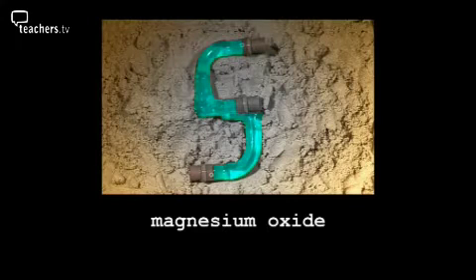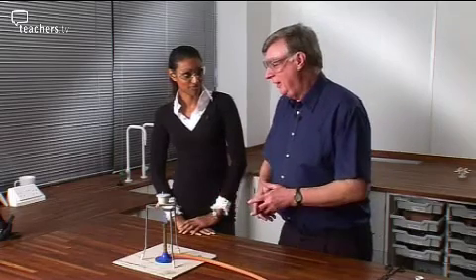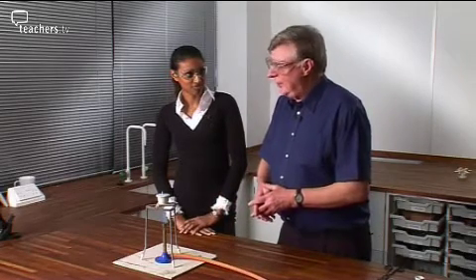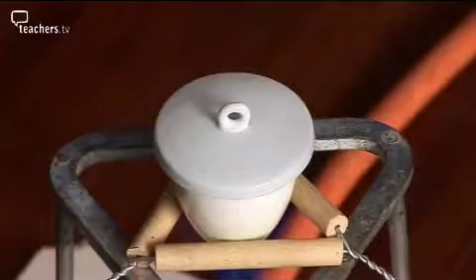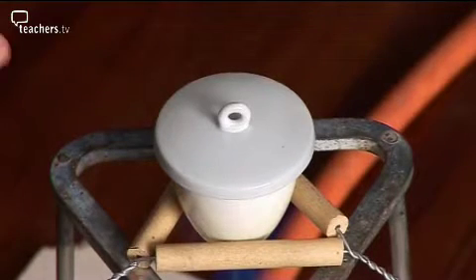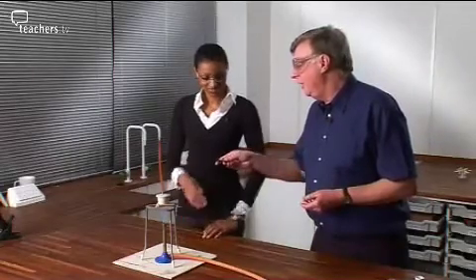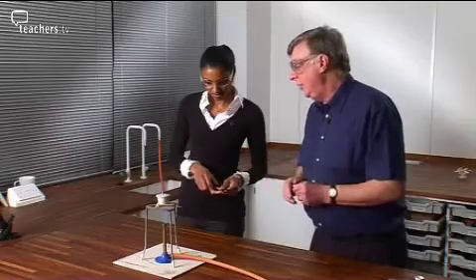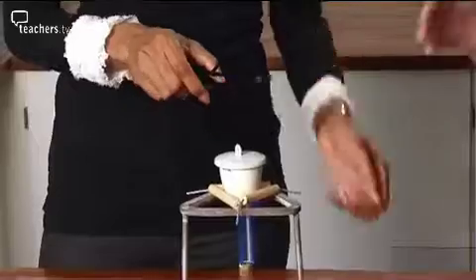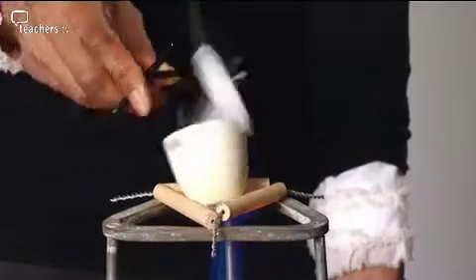Into the top 5, and it's the old classic, making magnesium oxide. This is a popular experiment carried out for GCSE, where we investigate the increase in mass as magnesium burns inside that crucible. Now, I'd just like you to lift the lid carefully so that we let some air into the crucible and see if the magnesium is alight. The tongs make it hard to check the reaction easily.